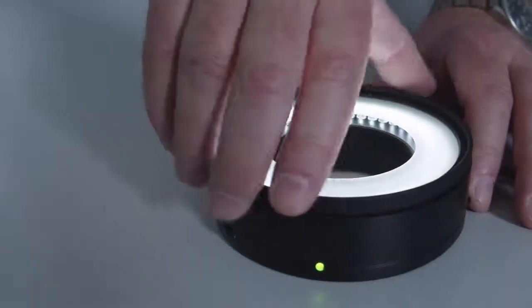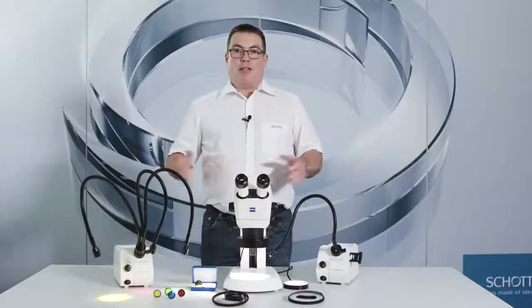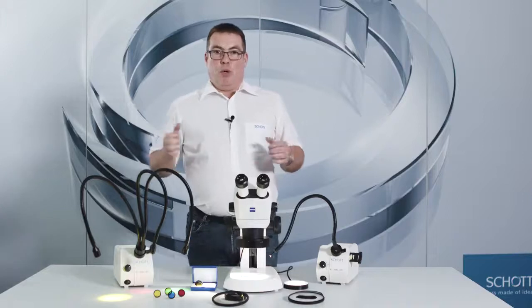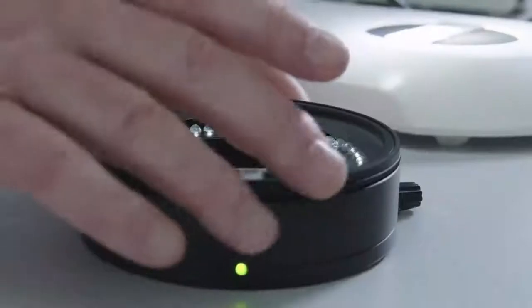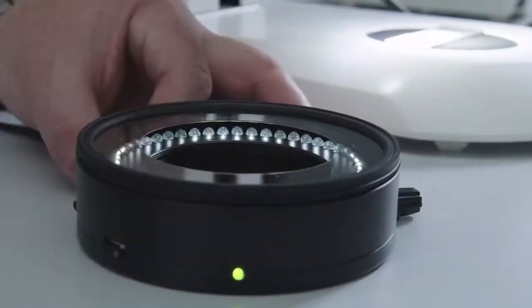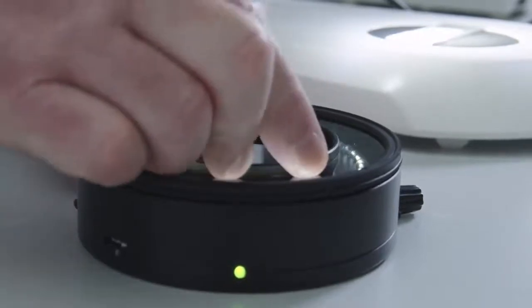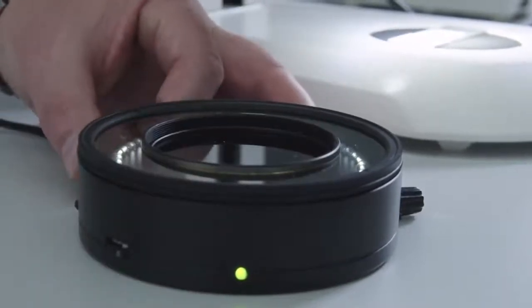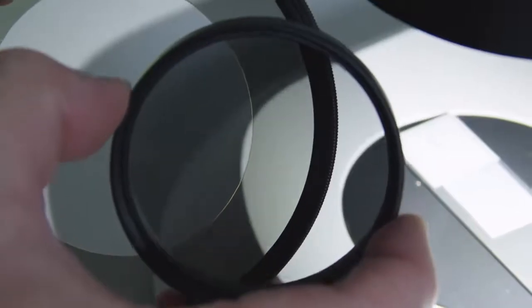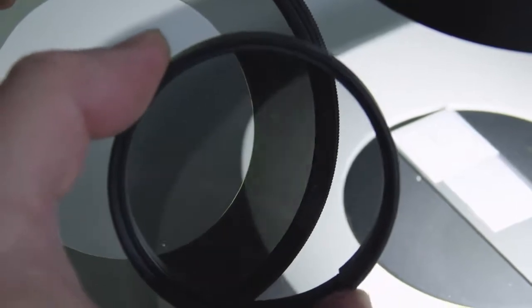They are screwed directly onto the ring light. Finally, I would like to introduce you to the polarization sets. For polarization, you always need two parts: the polarizer and the analyzer, which are typically oriented at 90 degrees to each other.